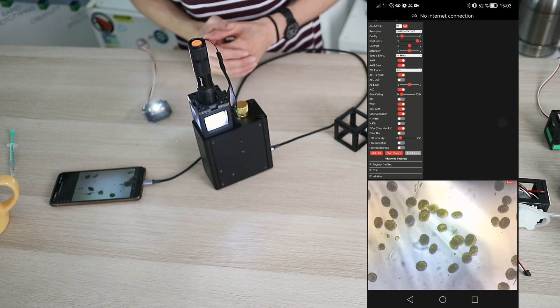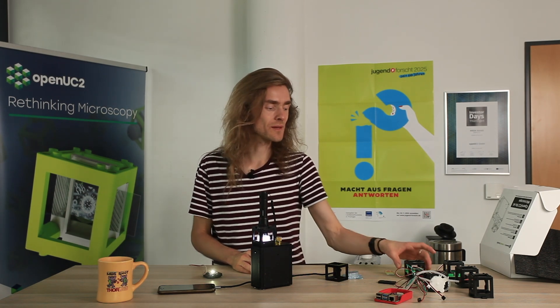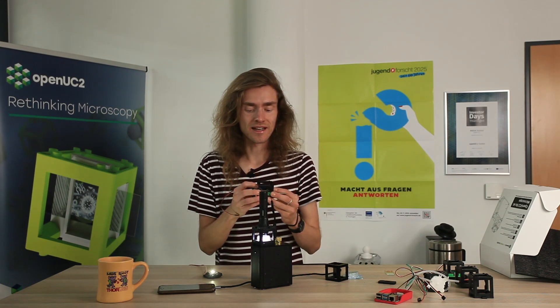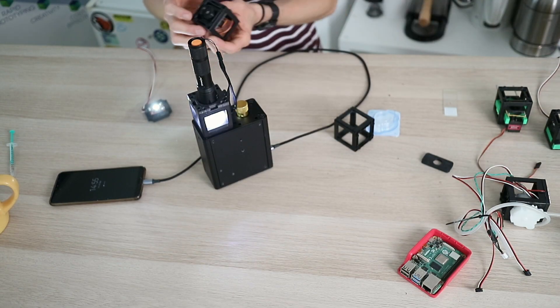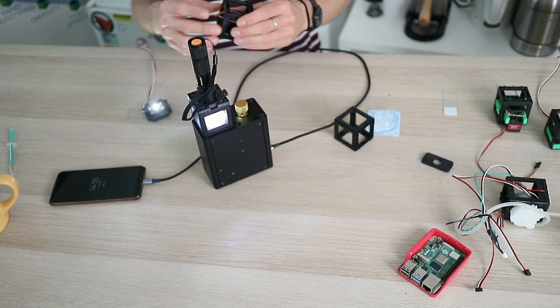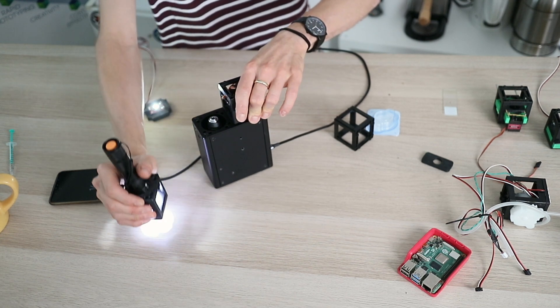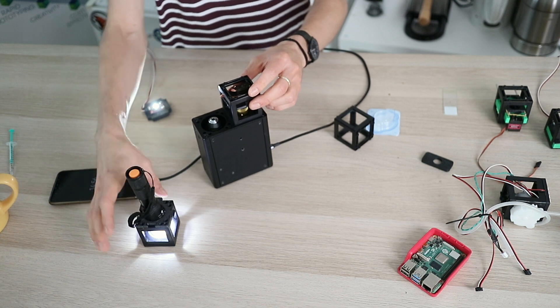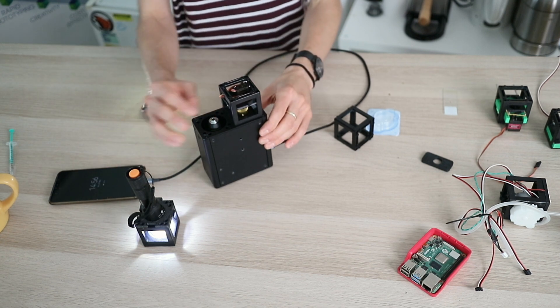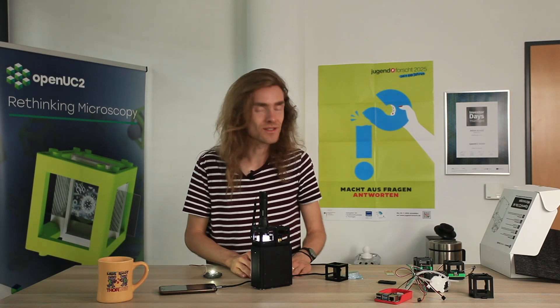The more you search the more you will find. This is just the first episode of a series of videos that we want to publish, to show you for example what you can do with just a little servo motor, some rubber bands, and 3D printed components — for example a little slide scanner. We also have a module that enables autofocus, so you can mount it on your microscope and use the focus knob which is then motorized. You can see why it's cool to have it modular — you can add any functionality you want. It's a little servo controlled by yet another ESP32 over MQTT, and then you can motorize your scope entirely and operate it from remote areas.